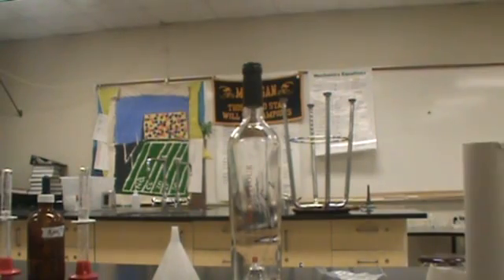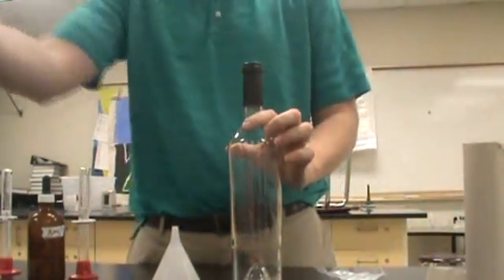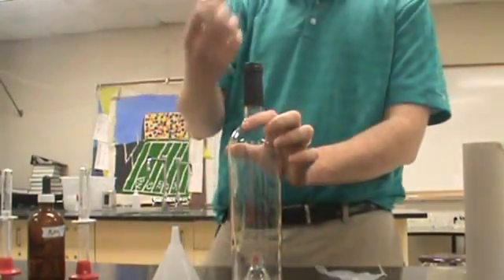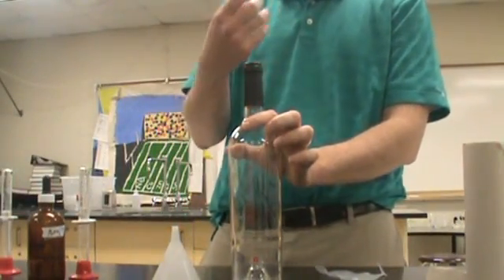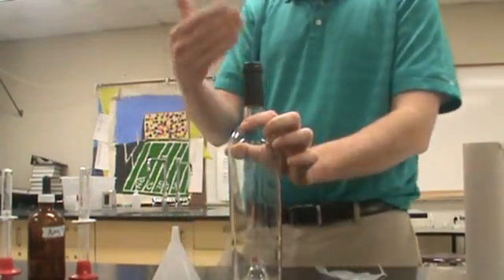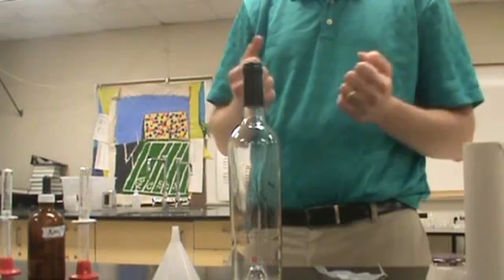And the setup for this kind of goes like this. So before I set up this video, I took a little bit of acetone and I poured it in the bottle. And what that's going to do is it's going to clean it off, but it's also going to dry very quickly. So highly volatile. Of course, you don't want to keep flame around it. But that's going to get this nice and dry and nice and clean.